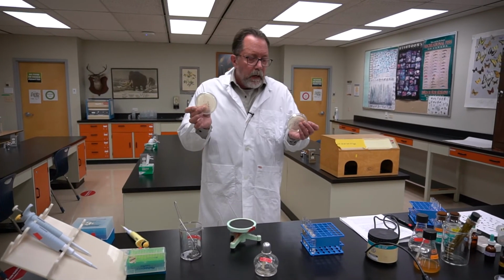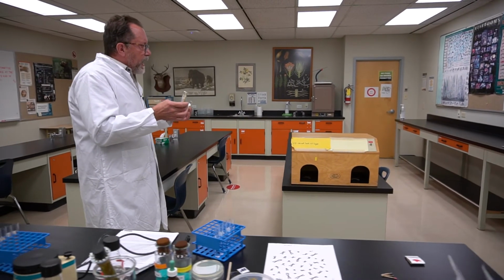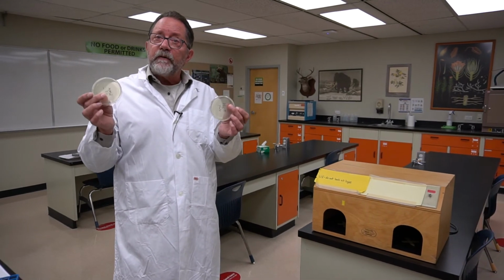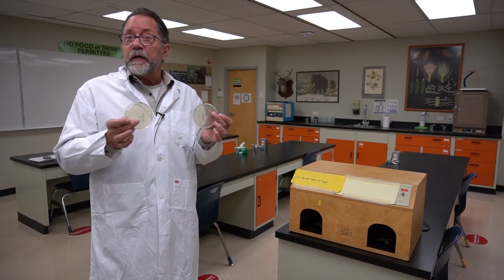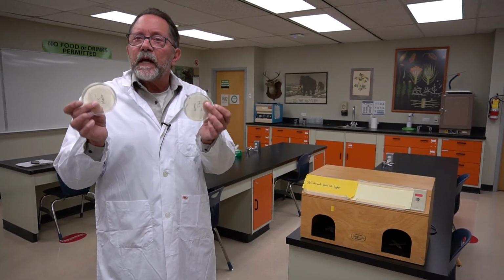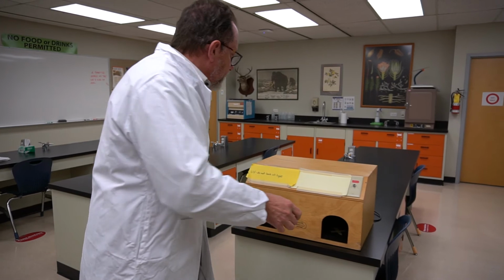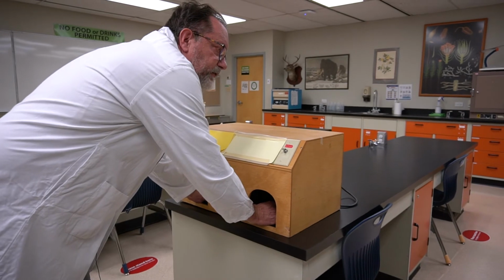Now, if you step over to the UV box, what would happen is you and your partner would have these plates labeled for time 0, 5 seconds, 10, 15, 20, 30. You'd put the 0-second plates aside, and let's imagine that these two are the 5-second plates for the killing effect and the mutagenic effect. You'd put those into the UV box. Your partner would be timing, and they'd say go.